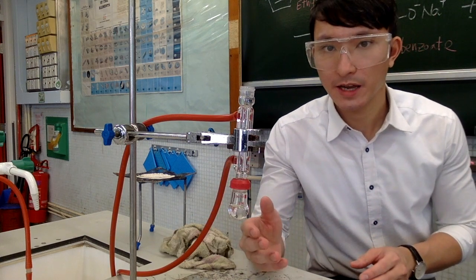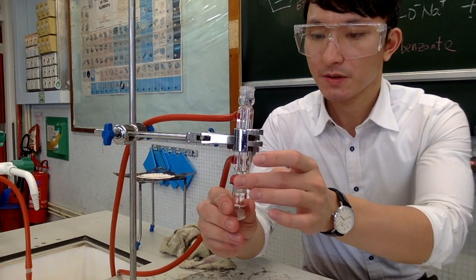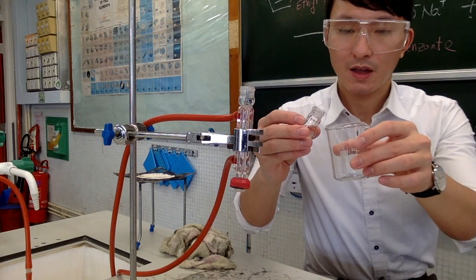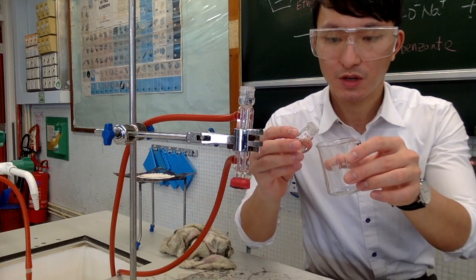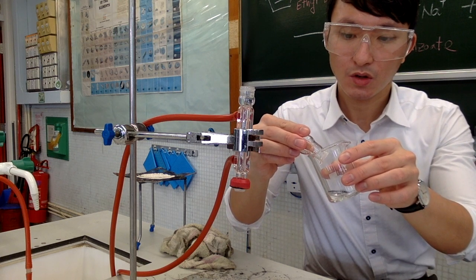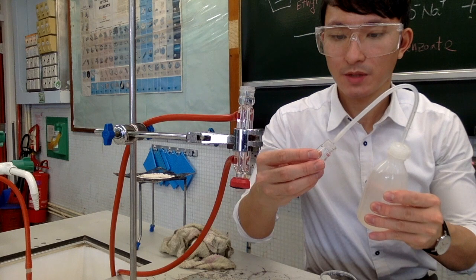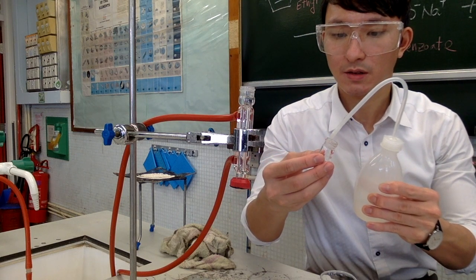After the round bottom flask has been cooled down, carefully remove it from the condenser and pour the content into a clean beaker. Pay attention not to also pour down the anti-bumping granules. Use distilled water to flush it several times in order to transfer more of the crude product into the beaker.